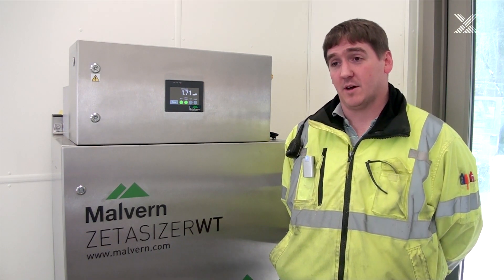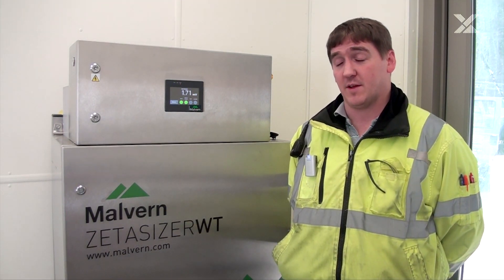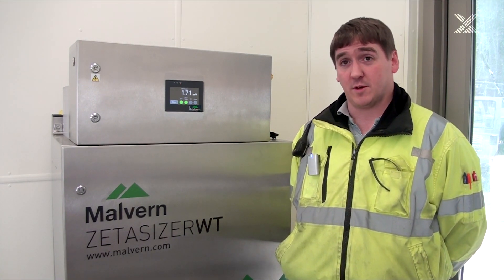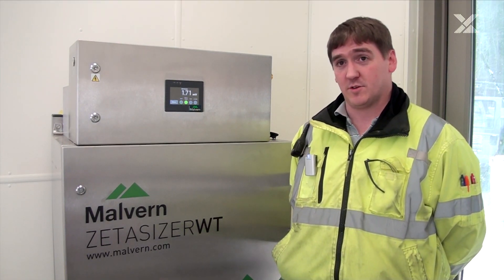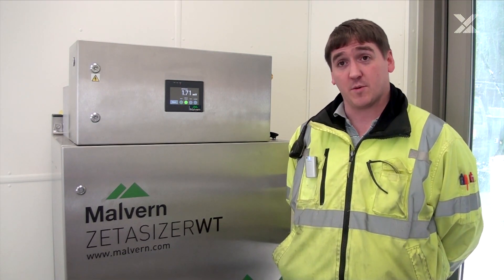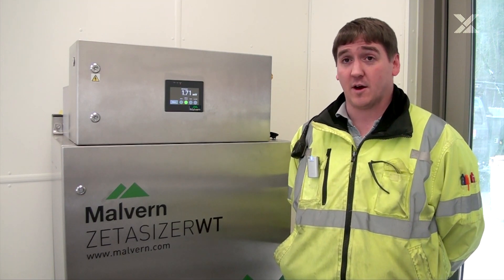The fact that it is online, it can tell us the overall sense when something is coming — as far as streaming current value, if the bulk of the water is changing — we can be sure and satisfied that we have treated the water properly. We haven't overshot it, spending chemical unnecessarily, when we only needed to make a small move. Sometimes it will tell us don't make a move at all — you're just fine where you're at. Turbidity changes we see rapidly aren't necessarily cause for action; this unit has been helpful telling us to stay where you're at, or increase it a little bit, don't overshoot it, because it's not worth the extra chemical and the added cost.